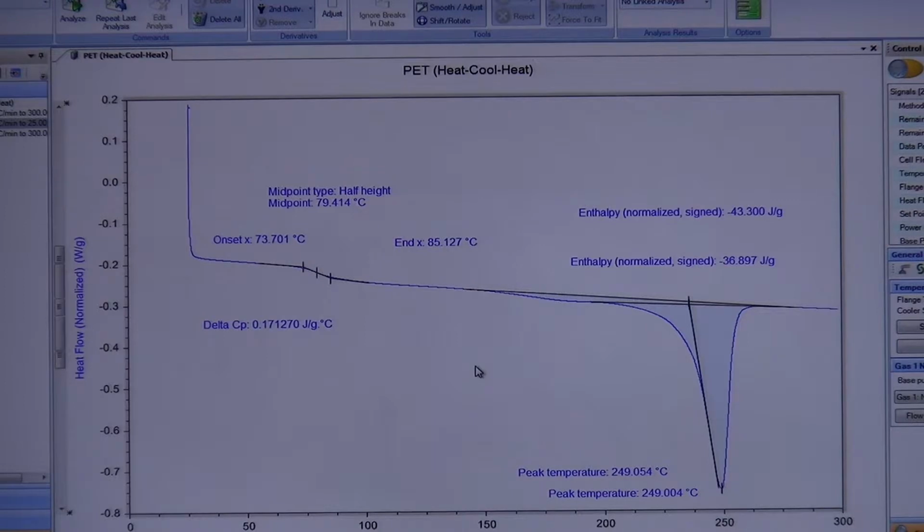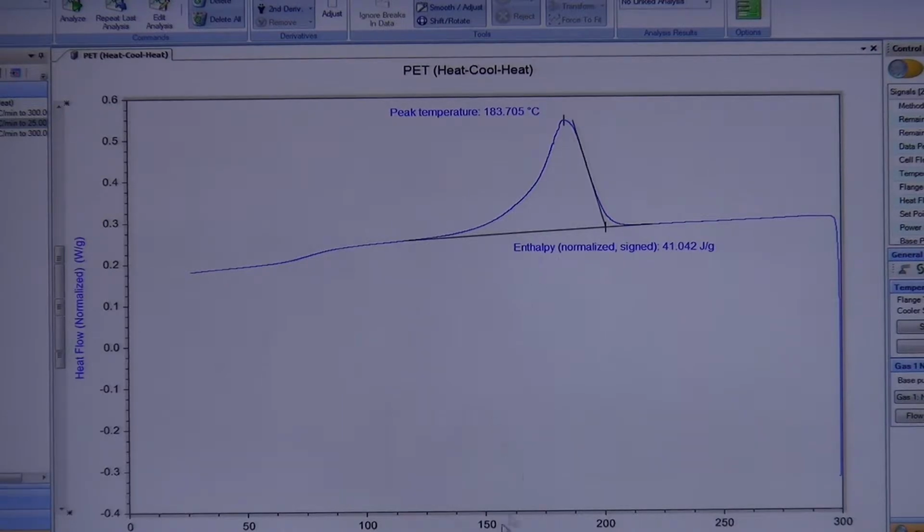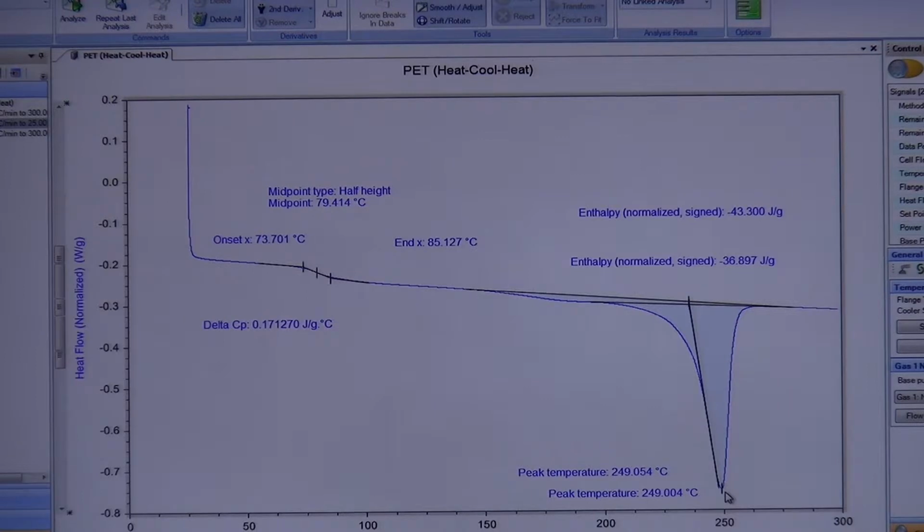Mm-hmm. In your opinion, then, what's the TC should be confirmed by the cooling? Yeah, the TC will then be confirmed by the cooling scan and not by the heating scan. And then the melting point would then be here. Okay. How about the TG? The TG would be this. If you don't care about what happened to your sample originally, then this is your TG. This is your bulk TG as it's defined.